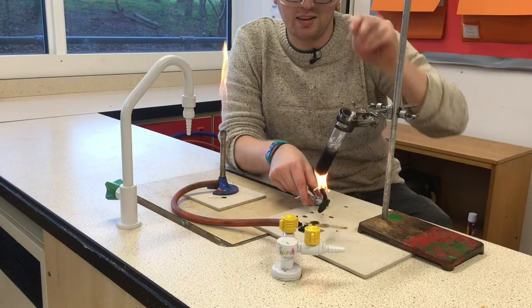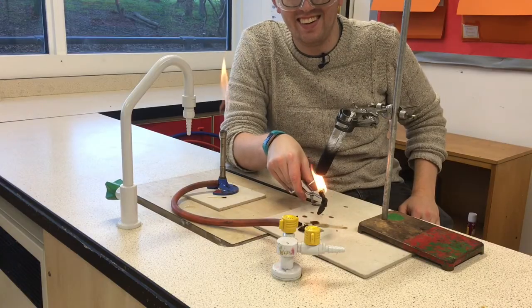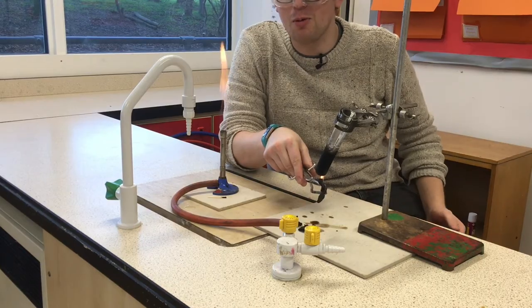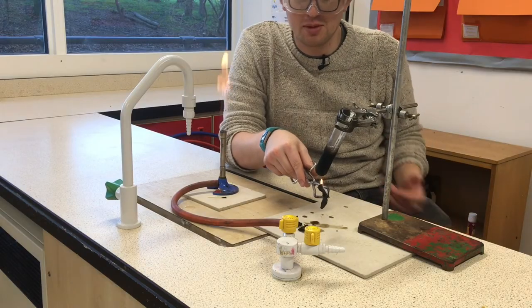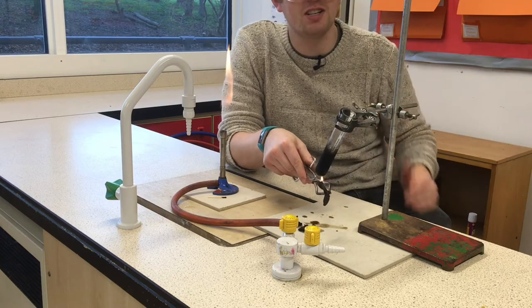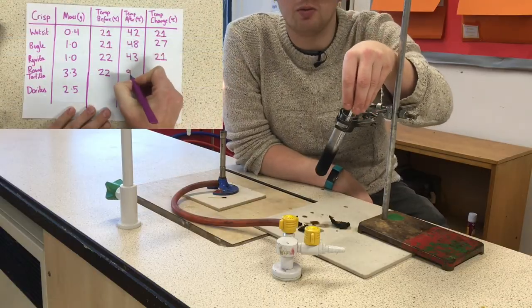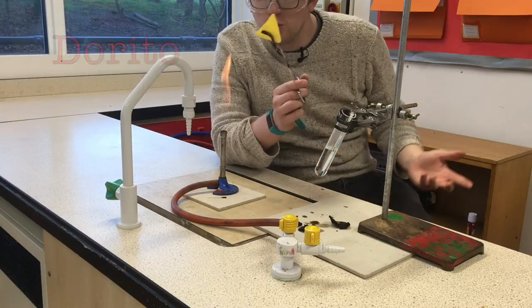Unbelievable — it's actually made the water boil, look at that! Now we've got the problem that the water is at 100 degrees but we're still burning, so we're not ever going to be sure of how much energy was actually in there. We can officially call that pretty dramatic — and funnily enough we're at 98 degrees.